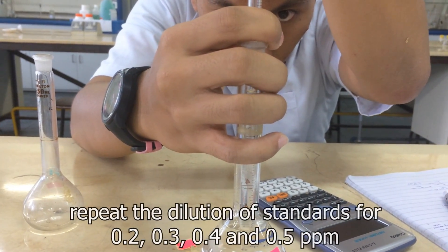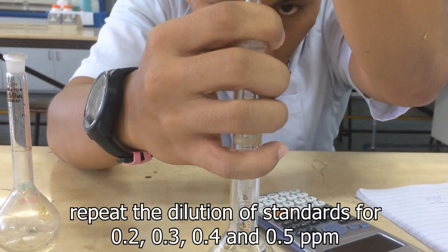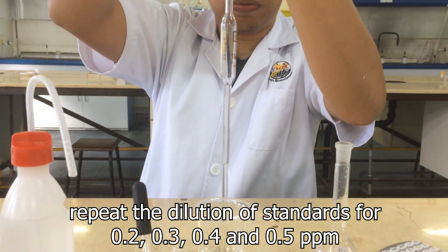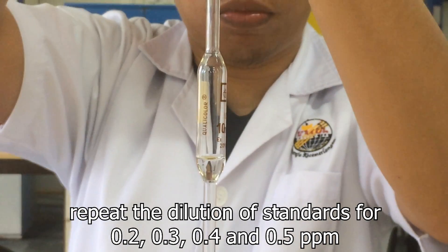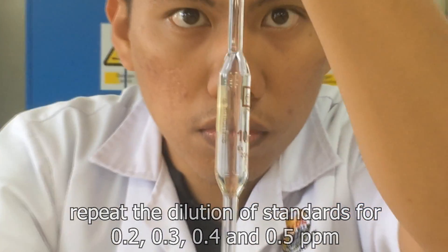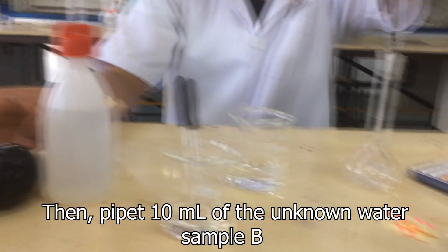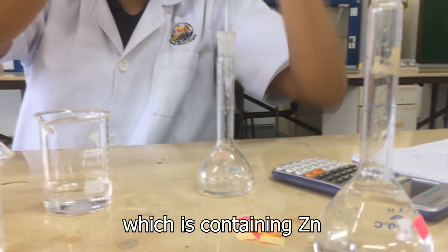Repeat the dilution of standards for 0.2, 0.3, 0.4, and 0.5 ppm.